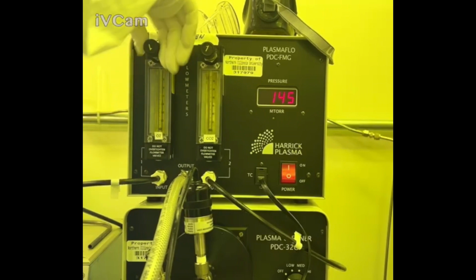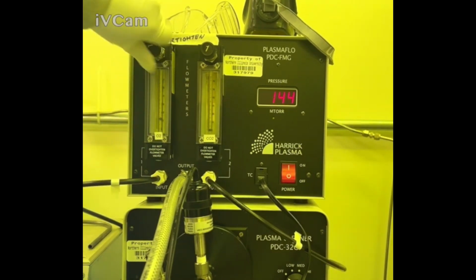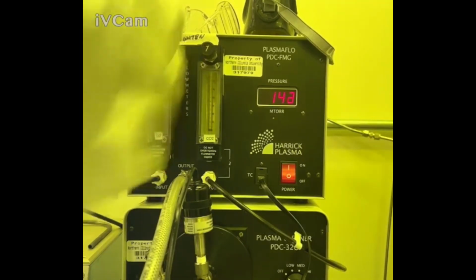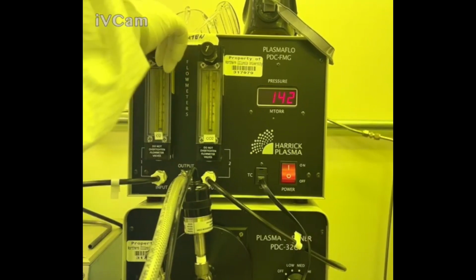Well, I don't exactly know what's happening. It was working like 2 minutes ago in a previous test. There we go. Wonder if it's just not. No, never mind. So there is some oxygen going in. It's not going in all the way, or it's leaking out. Something's happening. So I'm just going to close this off.